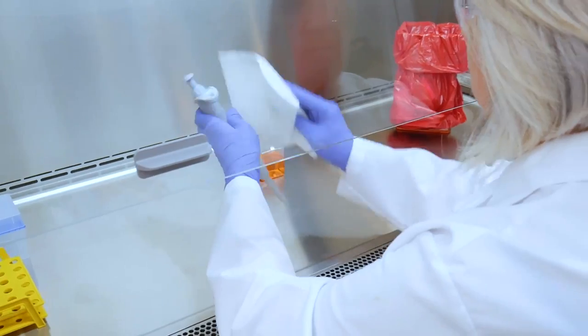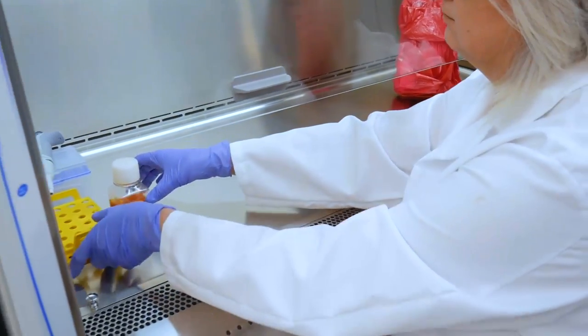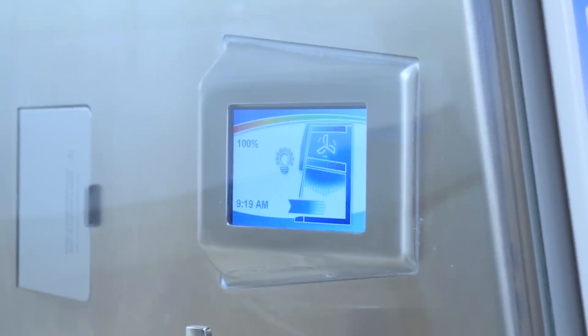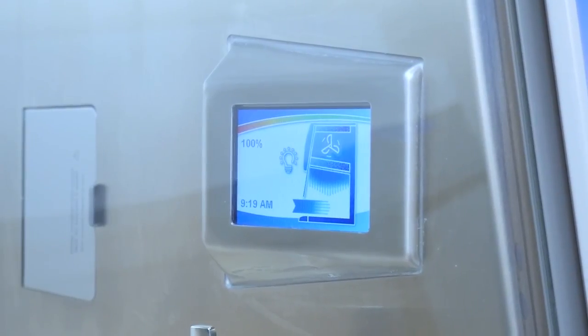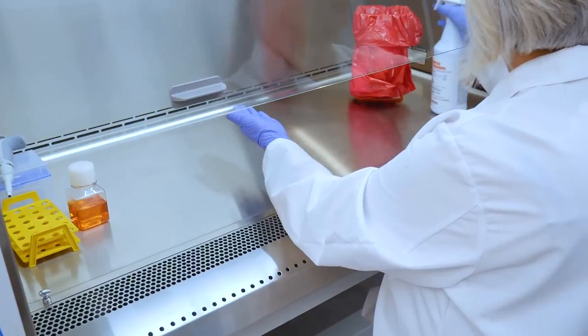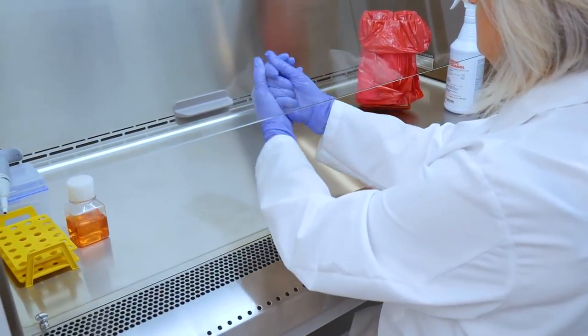Remember, anything placed into the BSC, including your hands, must be decontaminated before removing it from the cabinet. The interior mounted display on LabConco cabinets will help you stay informed about your cabinet at all times. If you must exit the BSC in the middle of work, fully disinfect your hands before exiting the biosafety cabinet.